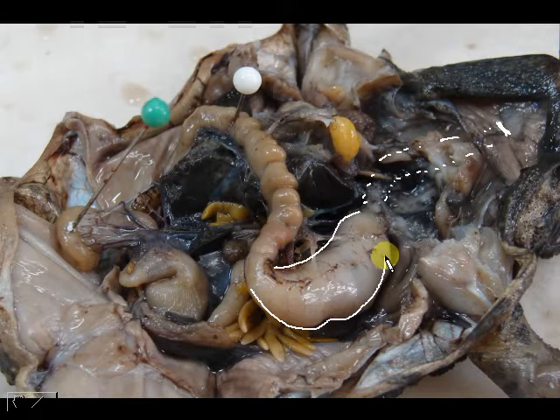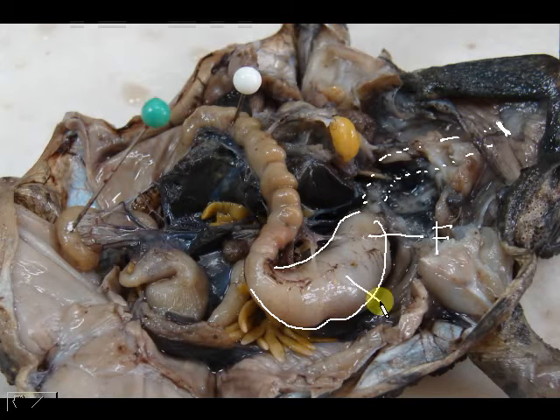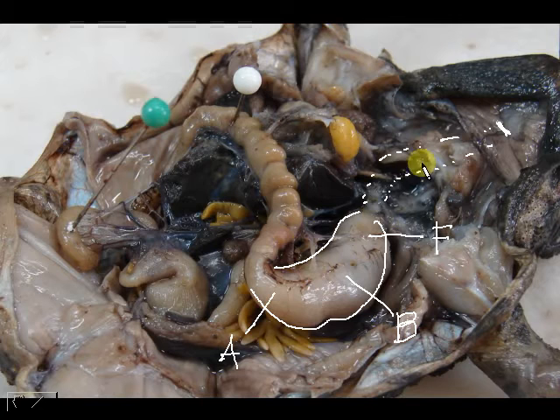Now the stomach has three main regions. The first curve is called the fundus, the larger part is called the body, and the final curve is the antrum. So those are the curvatures of your stomach — your stomach is pretty much shaped like a bean.